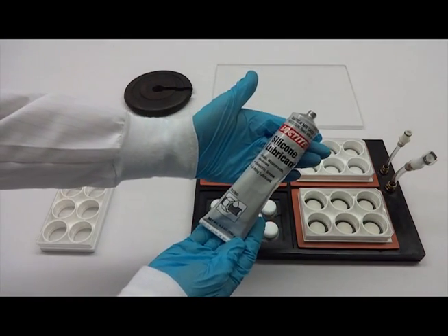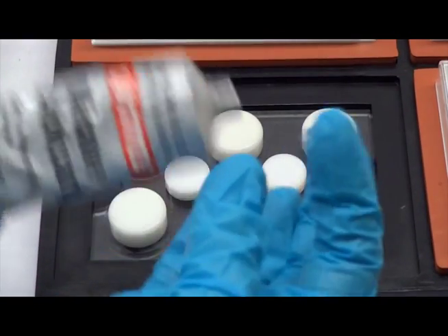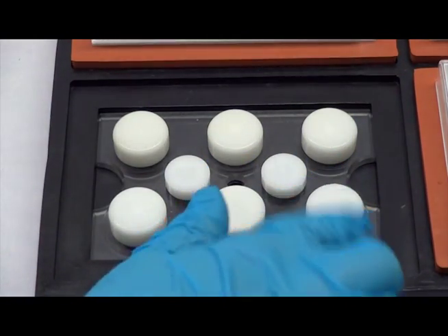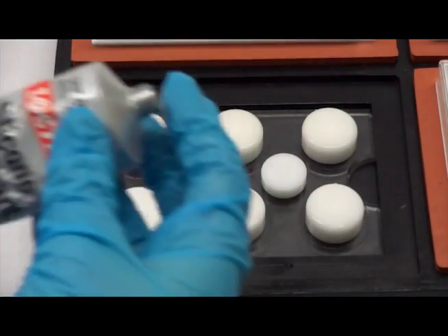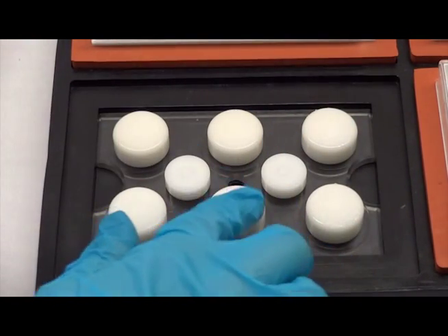Next, apply silicone lubricant to the top and top edges of each of the loading posts. Ensure that you remove and reapply lubricant before each experiment.